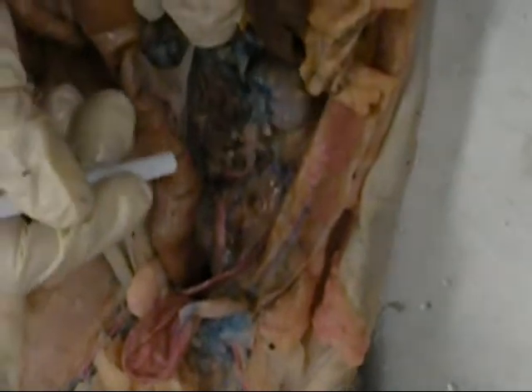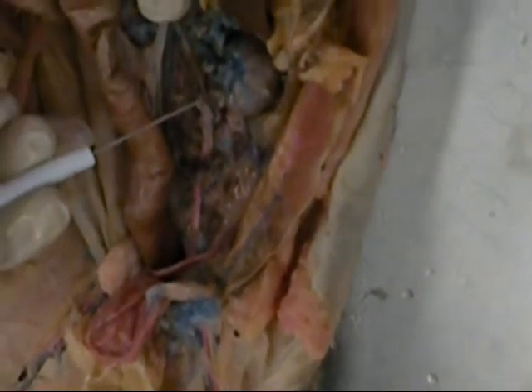This is a female cat, so as we look for the reproductive structures, we're going to have the gonadal artery and vein, which in the female can also be referred to as the ovarian artery and vein. On the right side, the vein enters directly into the inferior vena cava. On the left side, the gonadal vein enters first into the renal vein, and this one's been broken off, and then into the inferior vena cava from that.